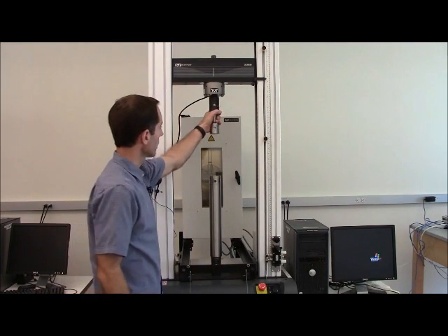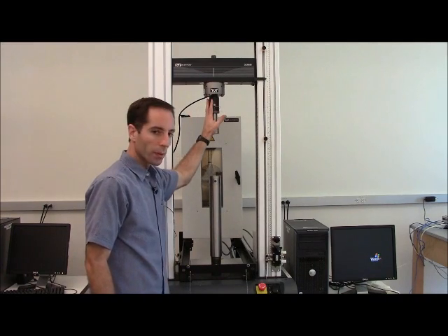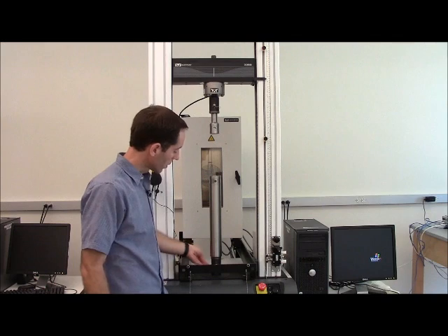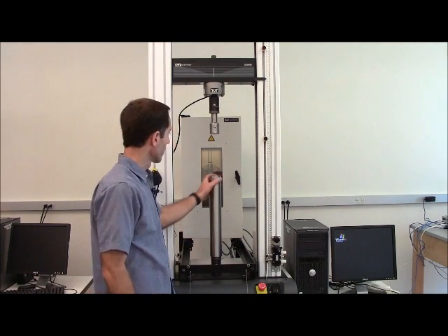With the top check nut tightened into place against the load cell that one's all ready to go. I've done the same with the bottom check nut tightened against the bottom mount. This is now set and ready to go.